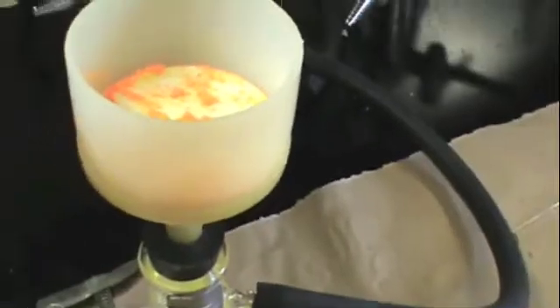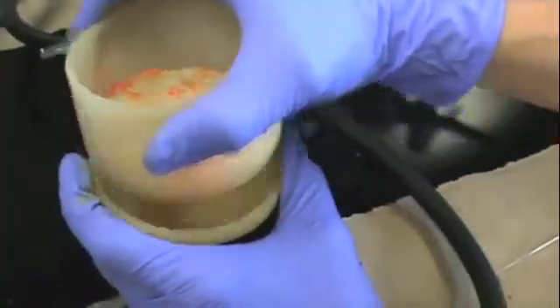Once the vacuum is turned off, you can remove the top part of the funnel and save it for your next lab, either in your drawer or on the benchtop.